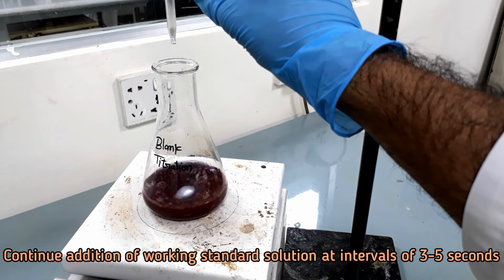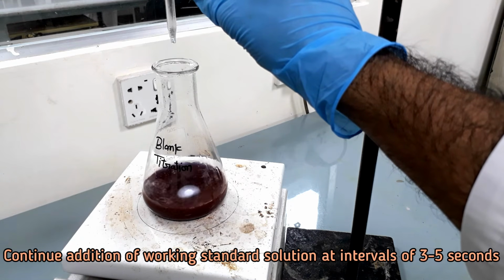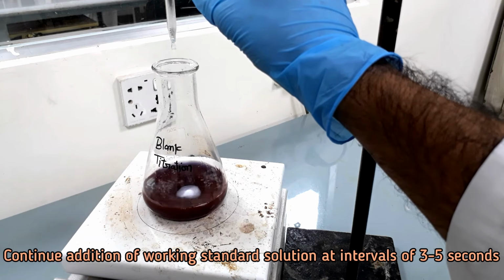Continue addition of sugar working standard at intervals of 3 to 5 seconds.